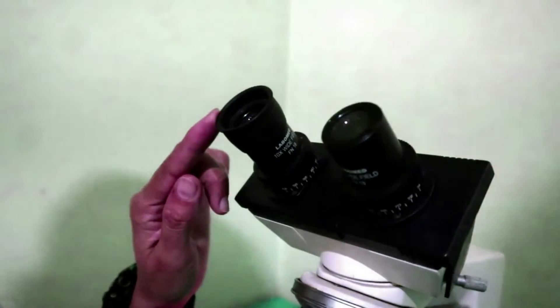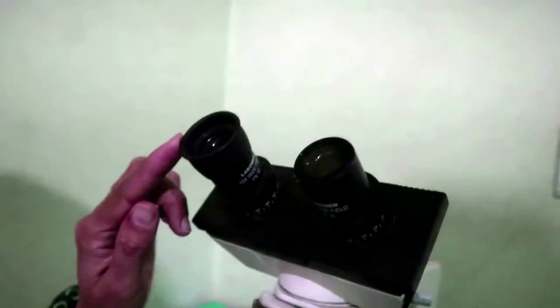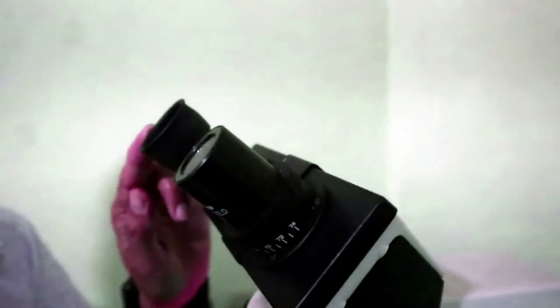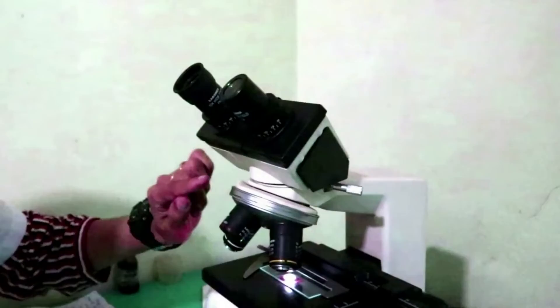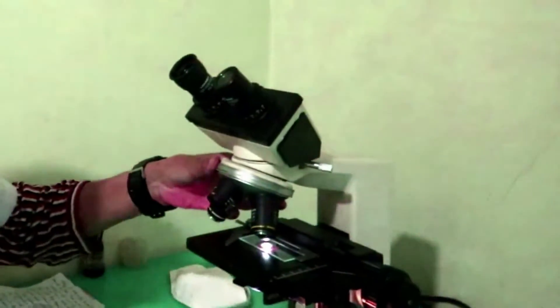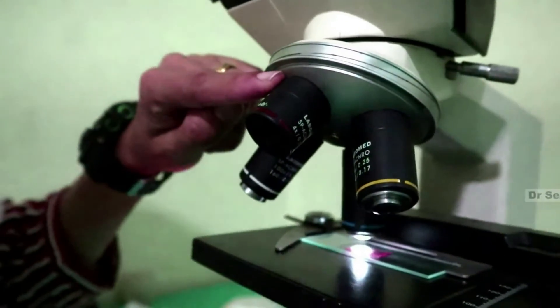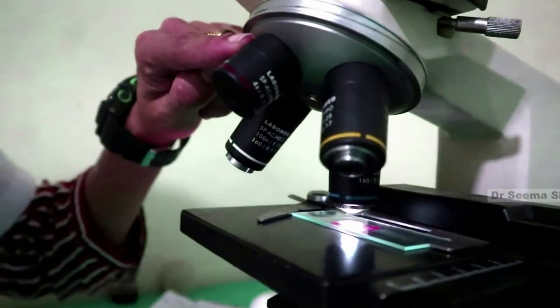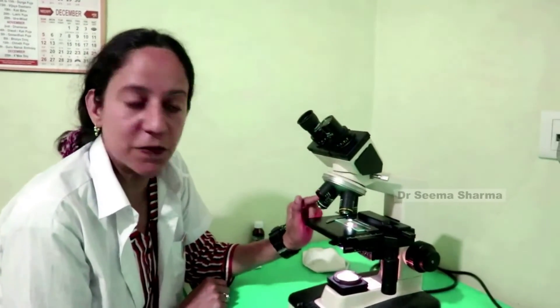It's a compound microscope. Let's know about its basic parts. First, the top part. Here, you can see there are two eyepieces through which we view the microscopic object. These eyepieces have magnifying lenses. Below the eyepiece, it has a nose piece. In the nose piece, there are four objective lenses of varying magnifying powers for further enlargement of the image of the object.